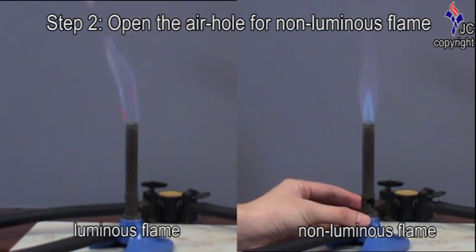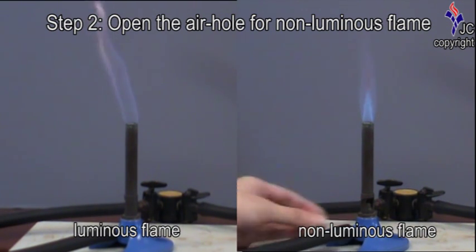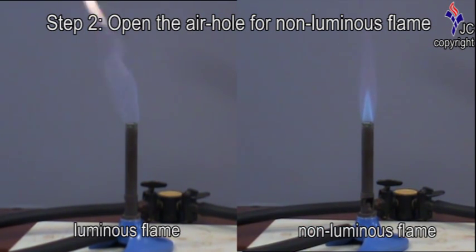Here, you can see the difference between luminous and non-luminous flame. For heating purposes using the Bunsen burner, always use a non-luminous flame.